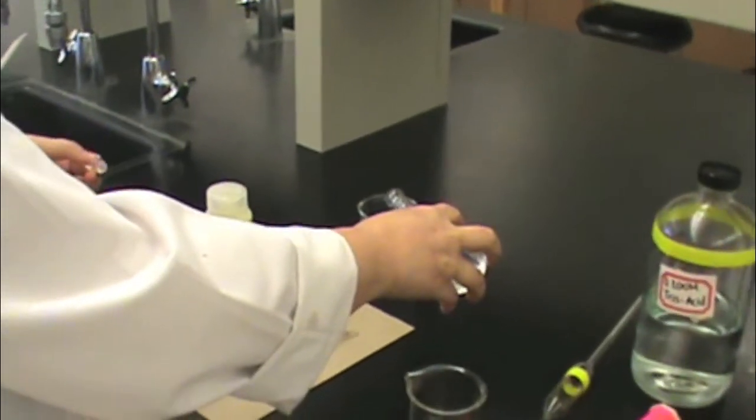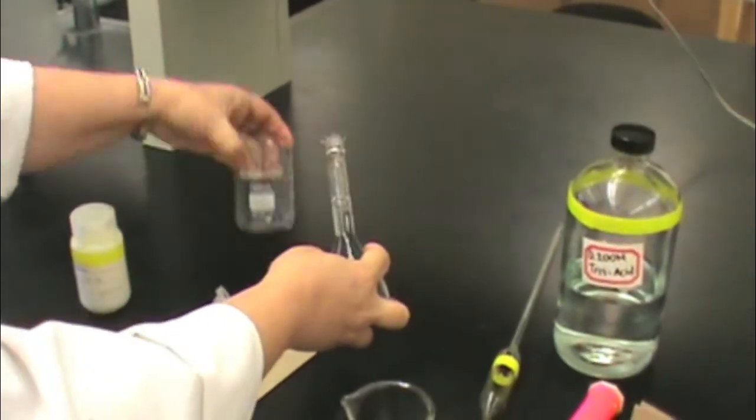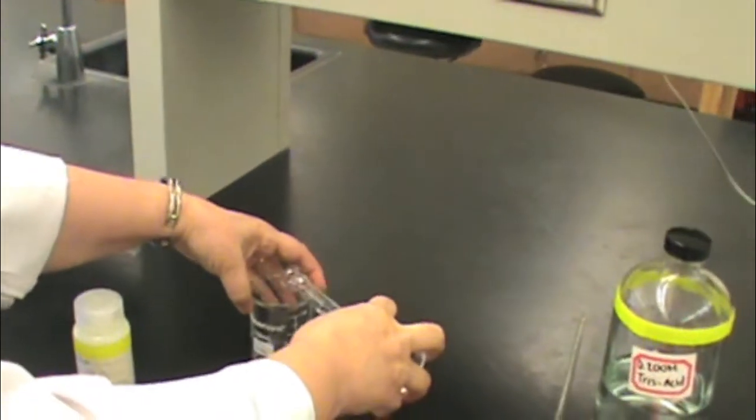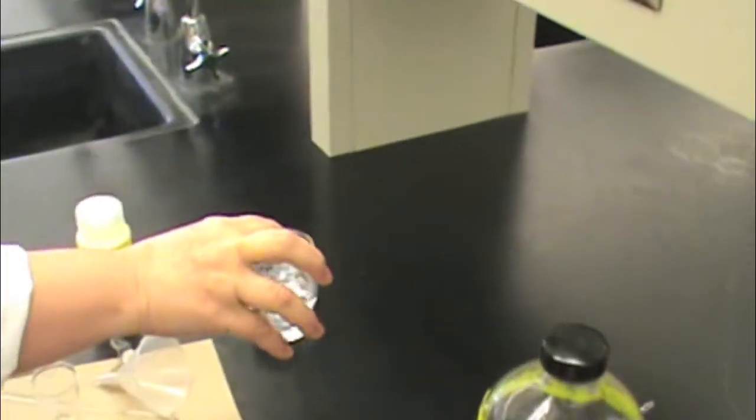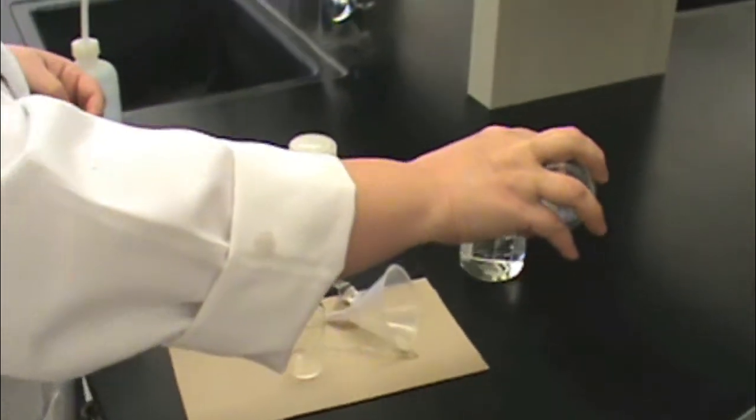Then open your solution and place it in a beaker marked high capacity buffer or concentrated buffer. Now you are ready to move on to the preparation of your diluted or low capacity buffer.